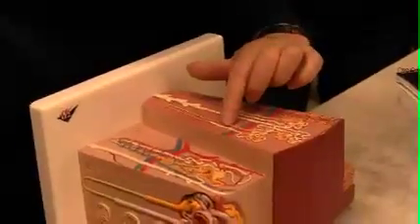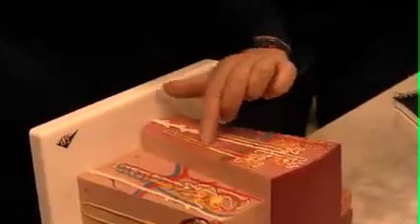This is a good one here. This is the cortex, remember, this is the medulla. This is very concentrated in salt. So that strong osmotic pressure pulls water out of the descending limb here. Simple squamous here, a lot of water comes out again into the capillaries surrounding this area.